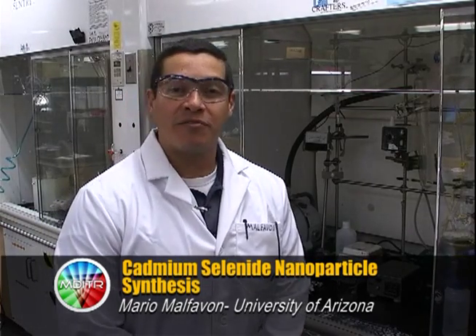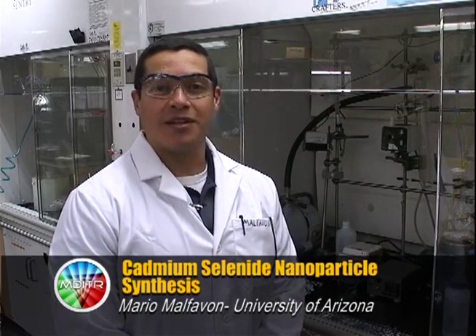Hello, my name is Mario Malfavon. This is the Armstrong Research Group Lab at the University of Arizona Chemistry Department, and today we'll be walking you through a cadmium selenide nanoparticle synthesis.